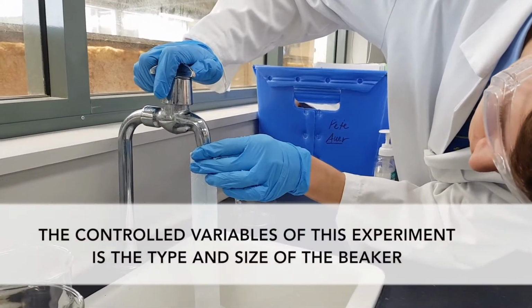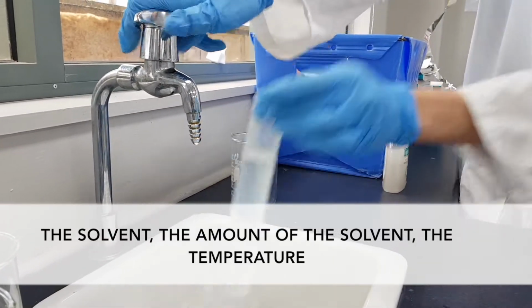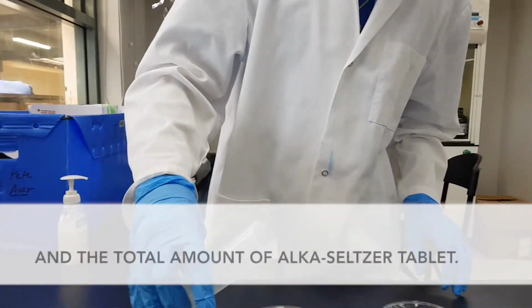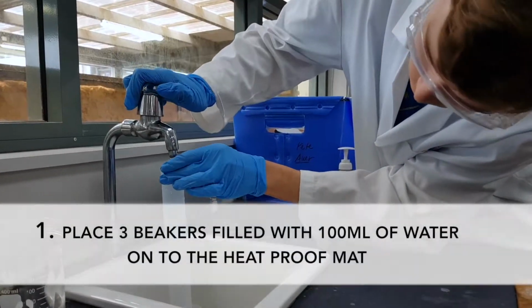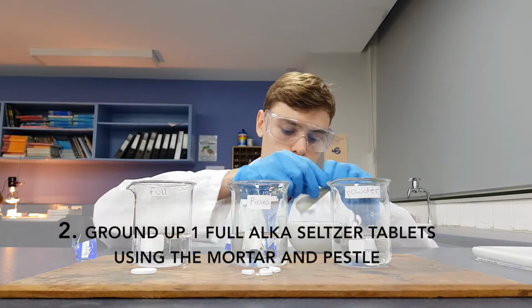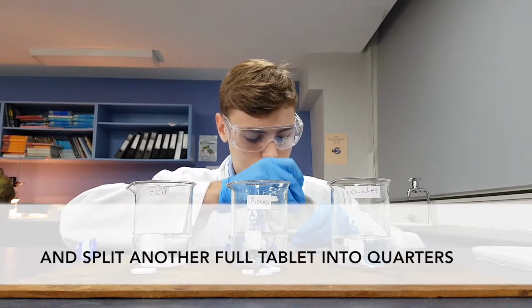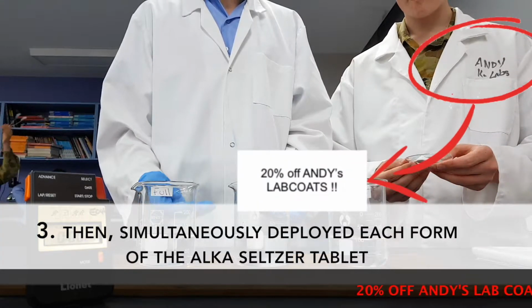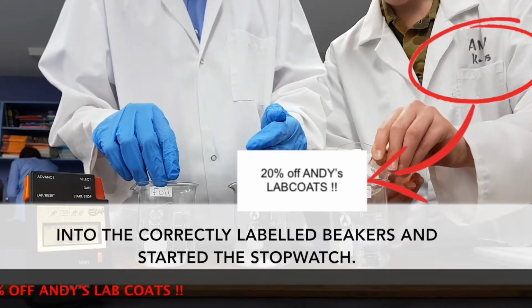And the controlled variables of this experiment are the type and size of the beaker, the solvent, the amount of solvent, the temperature, and the total amount of Alka-Seltzer tablet. Now to the steps. 1. Place 3 beakers filled with 100 ml of water onto the heat-proof mat. We had ground up 1 full Alka-Seltzer tablet using the mortar and pestle and split another full tablet into quarters. Then we had simultaneously deployed each form of the Alka-Seltzer tablet into the correctly labelled beakers and started the stopwatch.